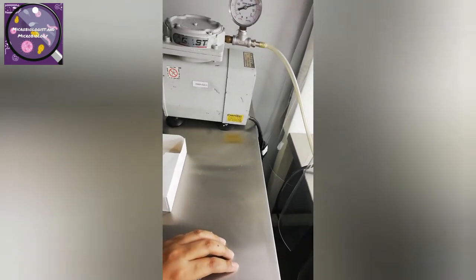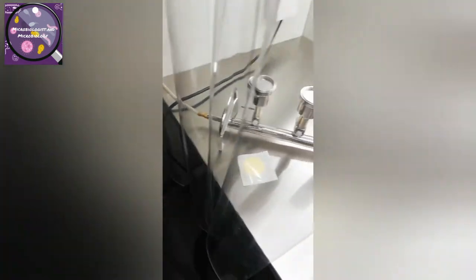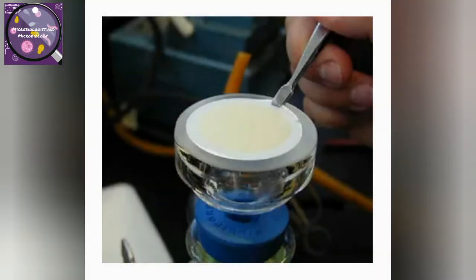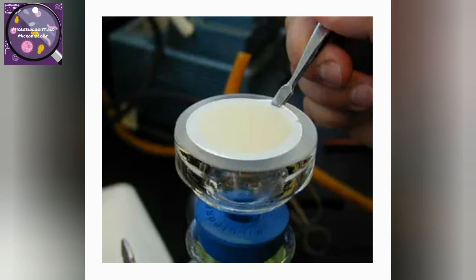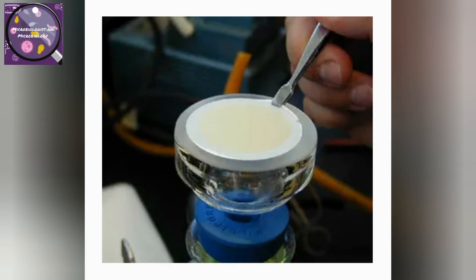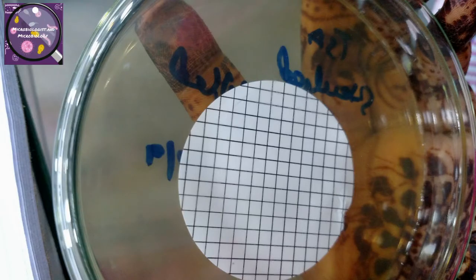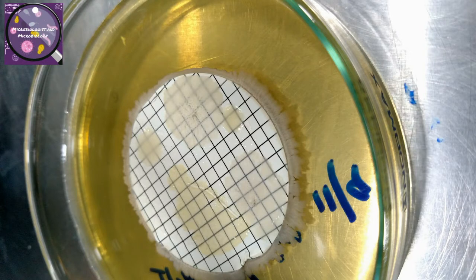Any organisms in the sample are concentrated on the surface of the membrane. A membrane with its trapped bacteria is then placed in a special plate containing a pad saturated with the appropriate medium. The passage of nutrients through the filter during incubation facilitates the growth of organisms in the form of colonies on the upper surface of the membrane. Discrete colonies thus formed can be easily transferred to confirmation media.